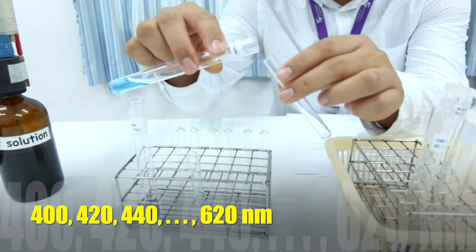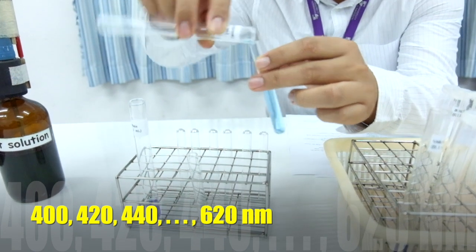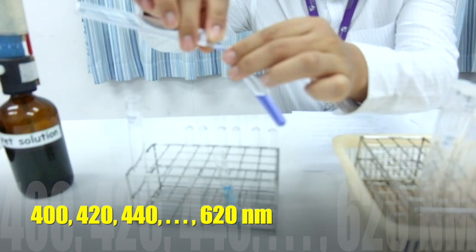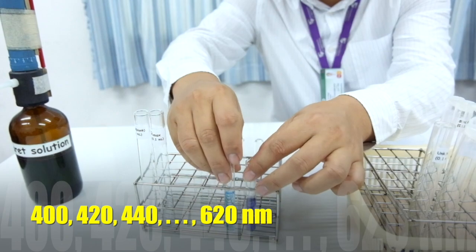After that, pour the solution into each cuvette and determine the absorbance at wavelengths from 400 to 620 nanometers with a 20 nanometer interval.